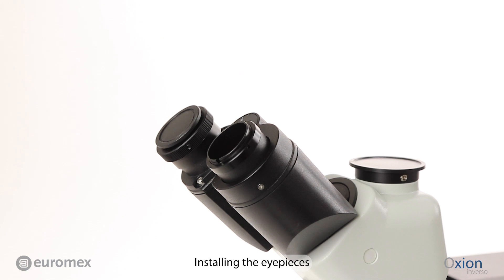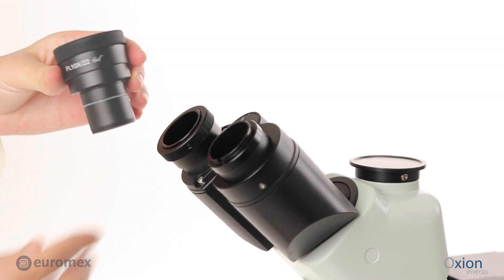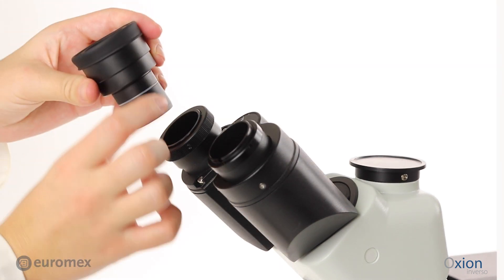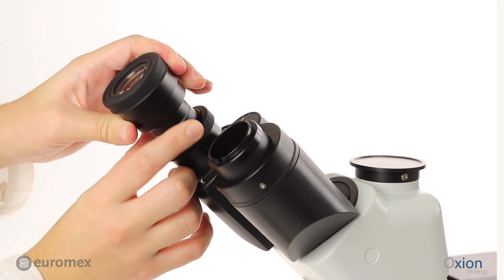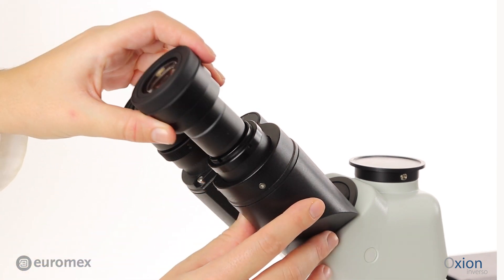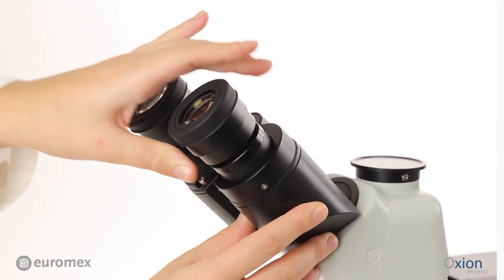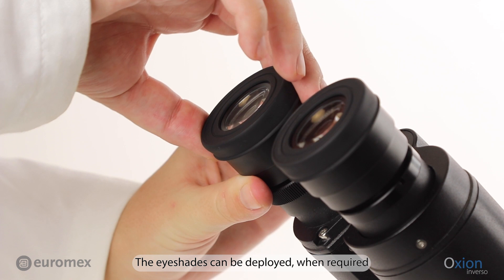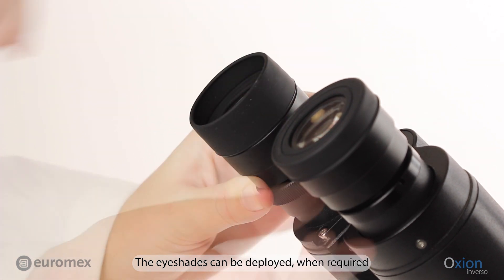Installing the eyepieces. The eyeshades can be deployed when required.